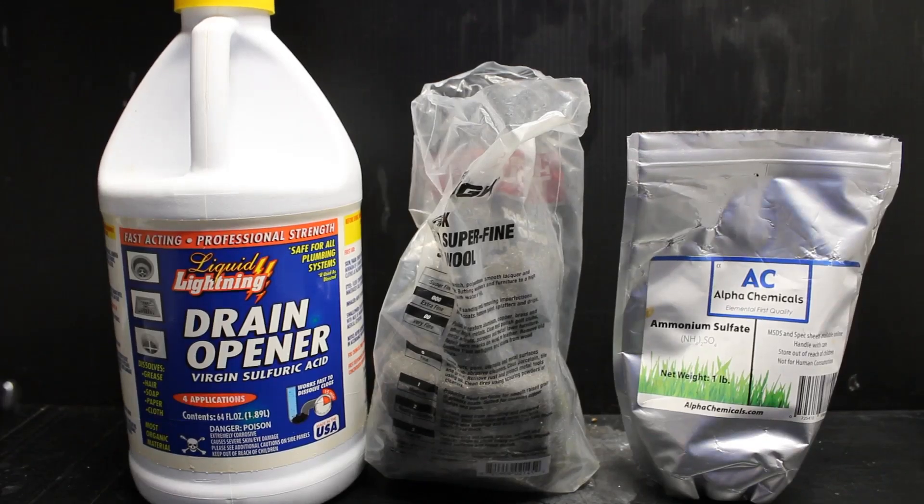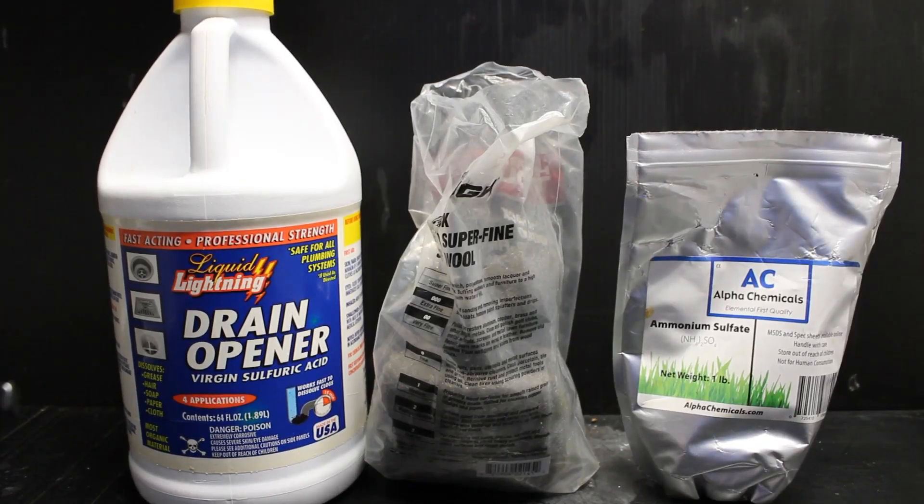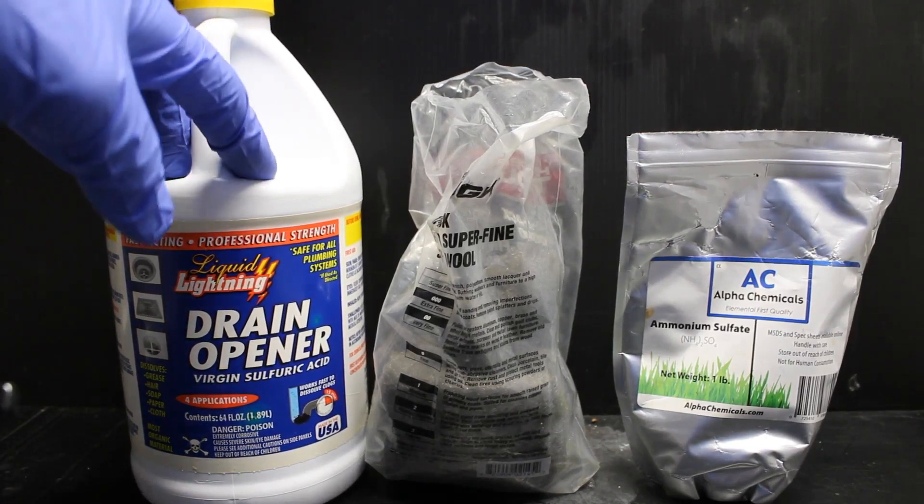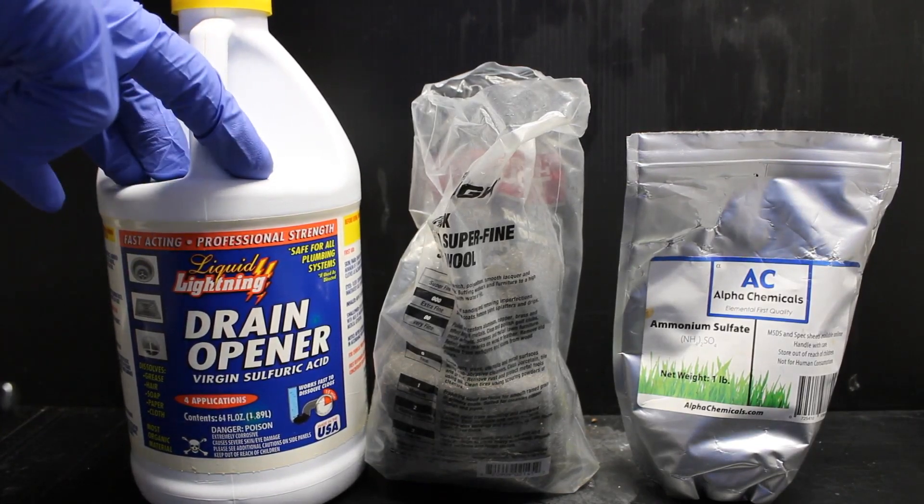For this experiment, you'll need from left to right: concentrated sulfuric acid, sold as drain cleaner, 91% in my case.